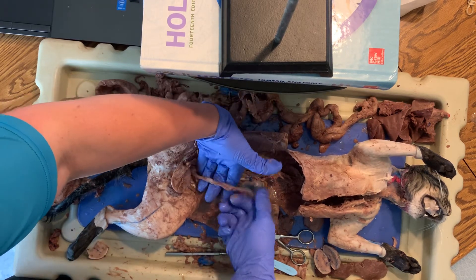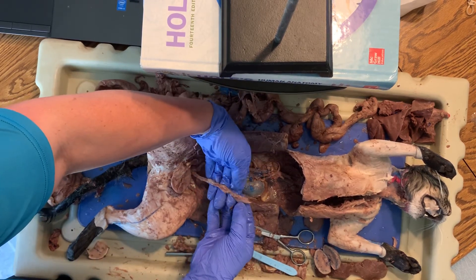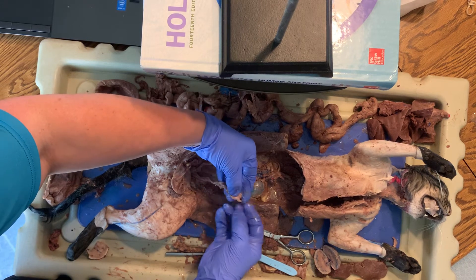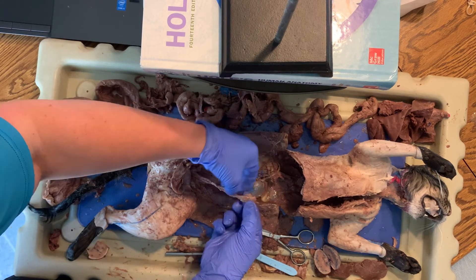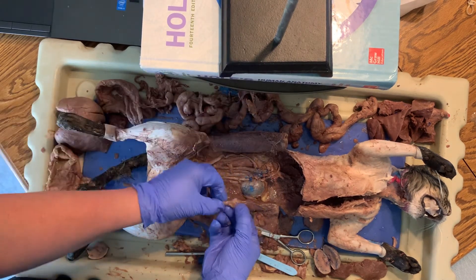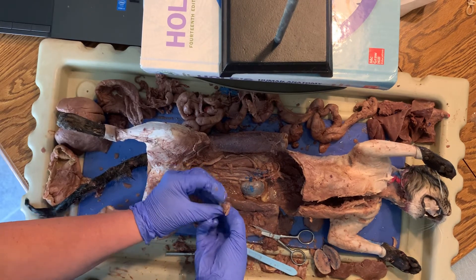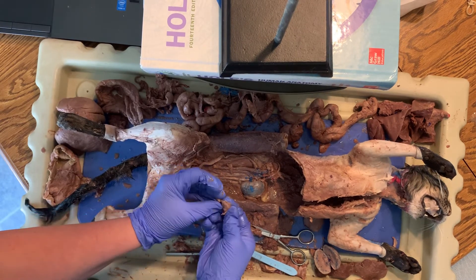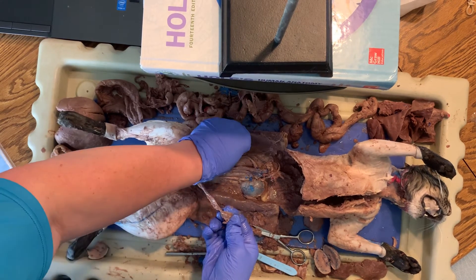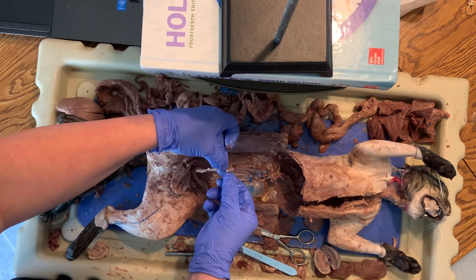Here's the left uterine horn — I didn't expose this one very well yet — but there's another little bean right inside of there. Right there. So those little things right there are the ovaries.